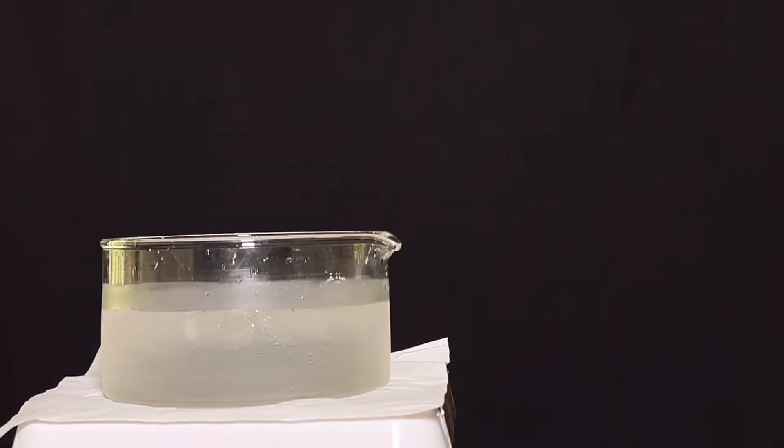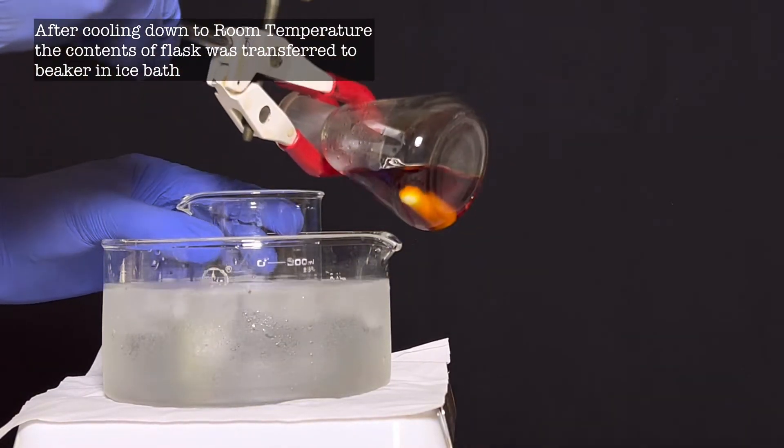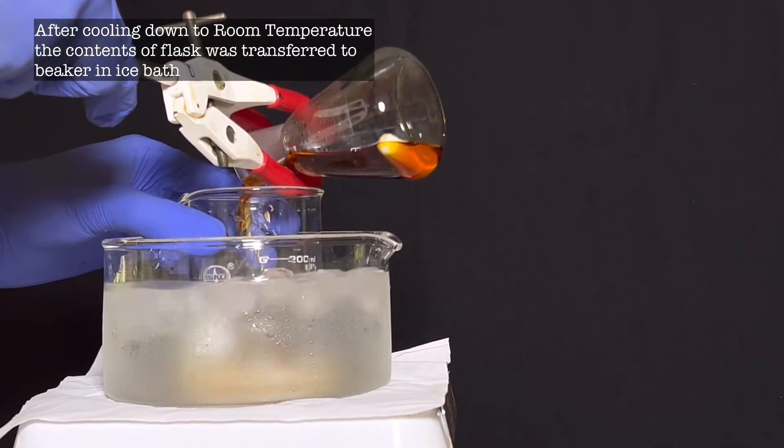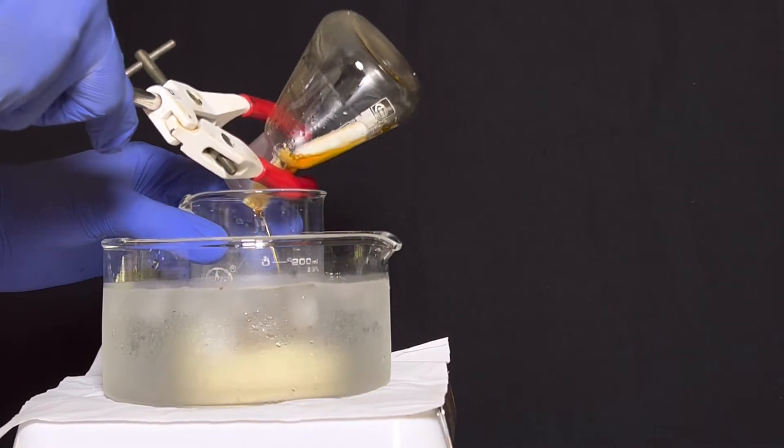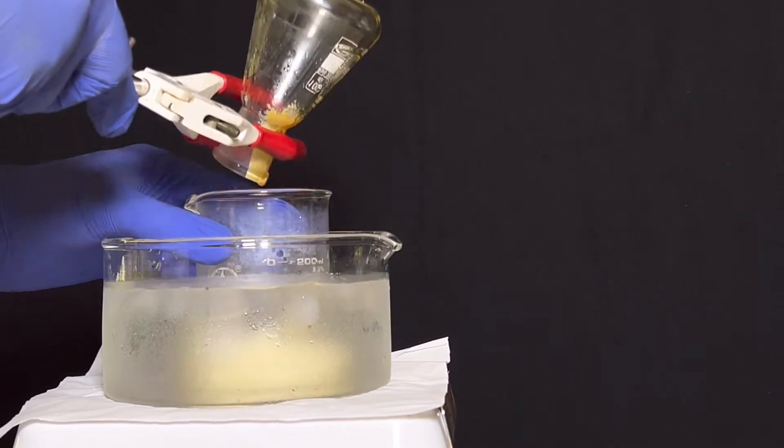After 30 minutes of reflux, the contents were poured into a 250 ml beaker which was placed in an ice bath. Mixture was then swirled until it solidifies.